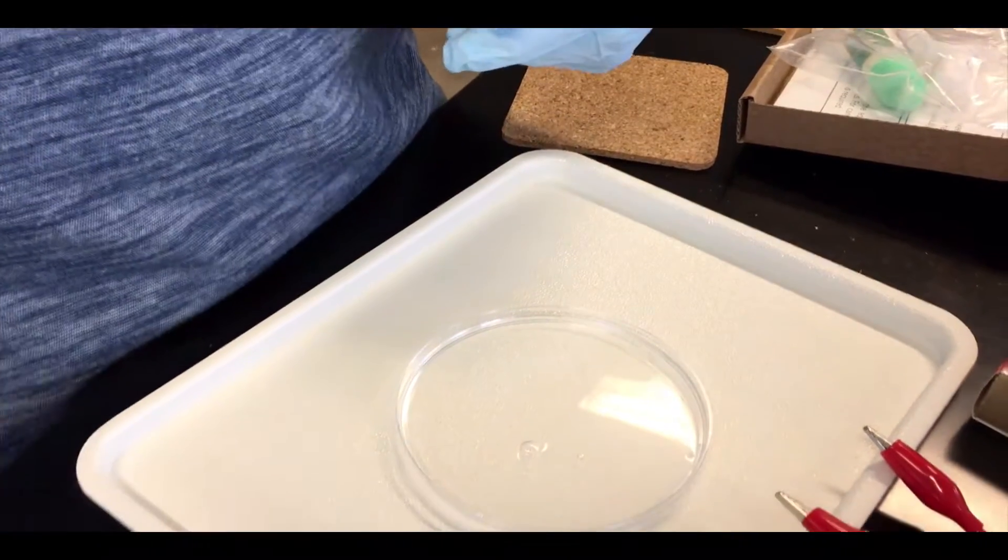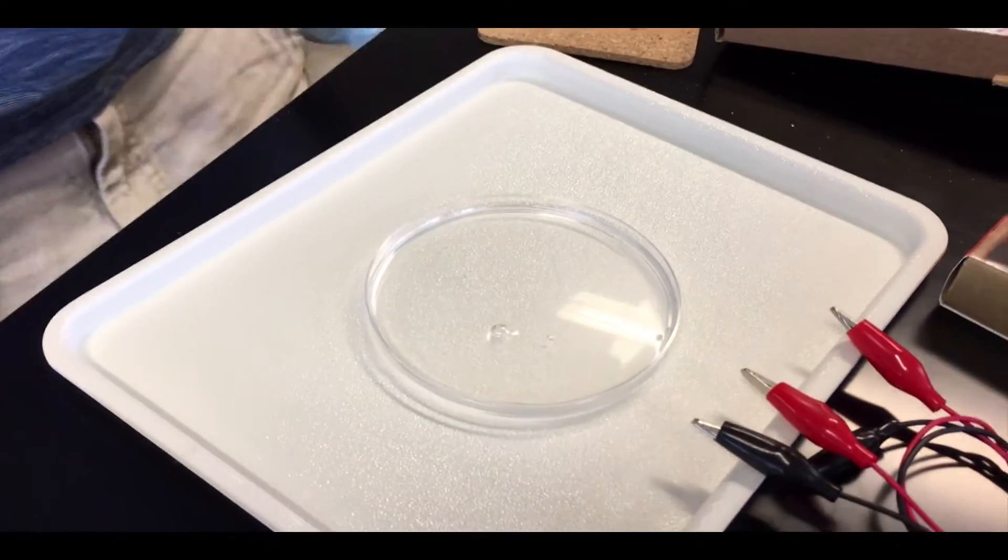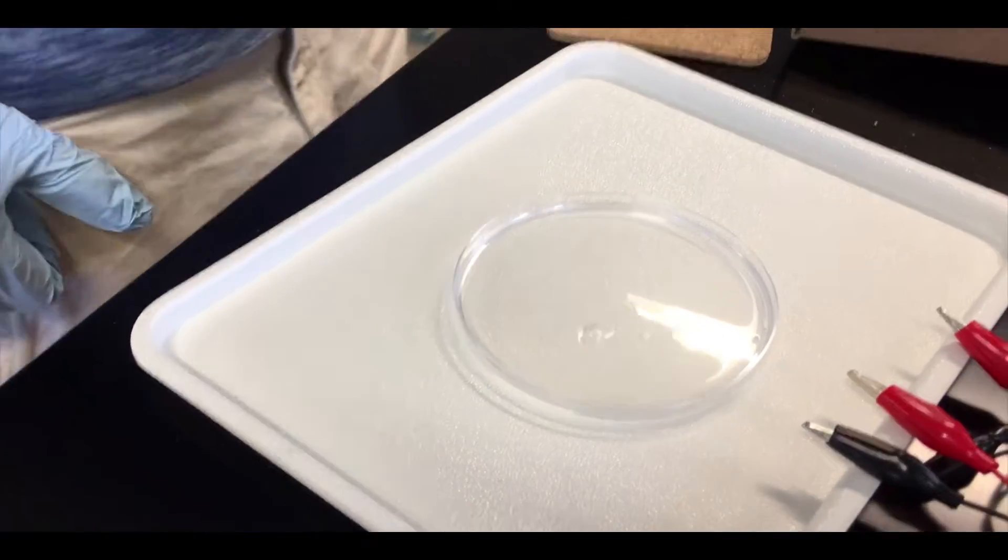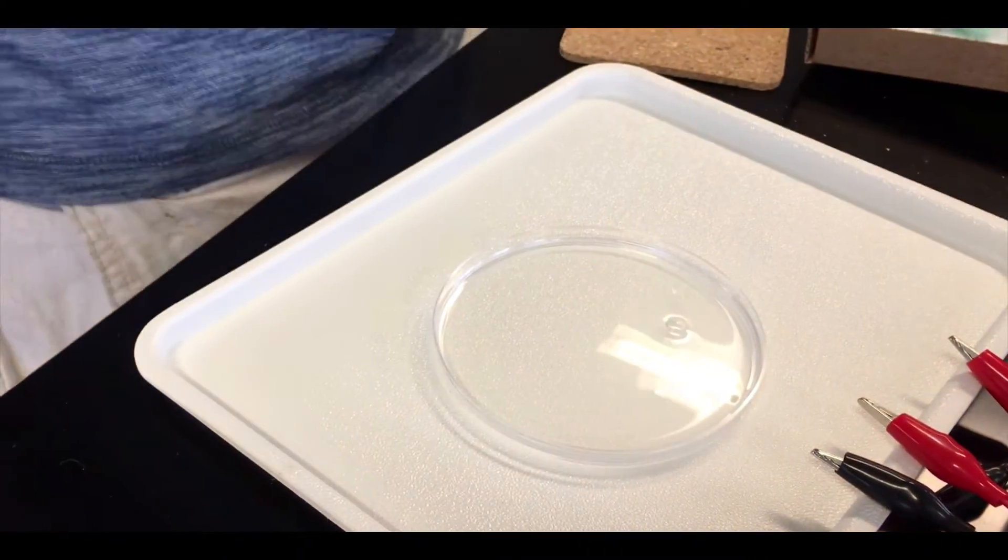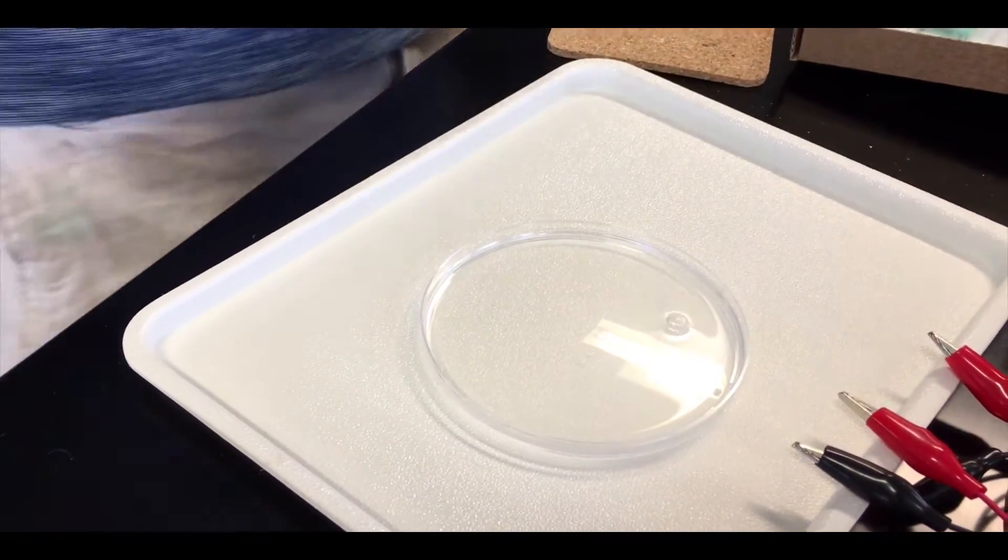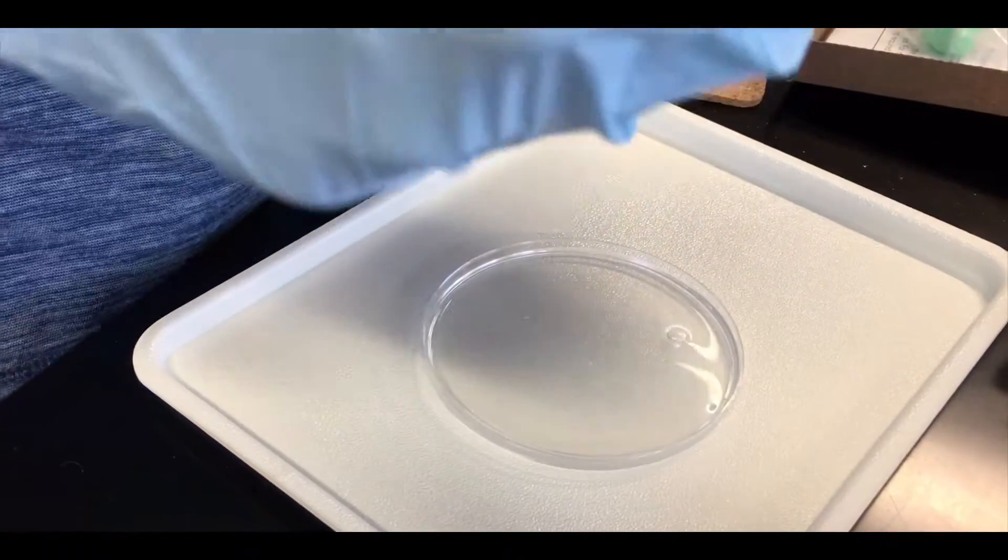It's cool how it spread out so nicely, messing with that surface tension. Bonds disrupted. Distribute liquid evenly, which was super easy—all we had to do was let nature work its magic.